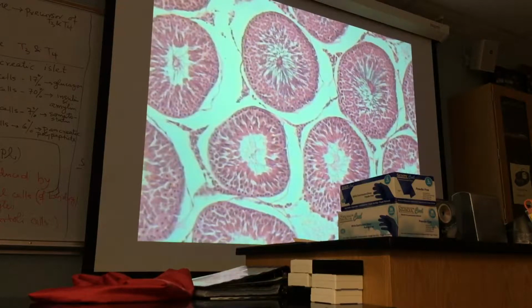And these segments may be of the same tubule, because if it is tightly coiled like this and you make a section, you are cutting the same tubule, but you see many sections. In the lumen here, or from here to here, all the cells, they represent different stages of spermatogenesis.